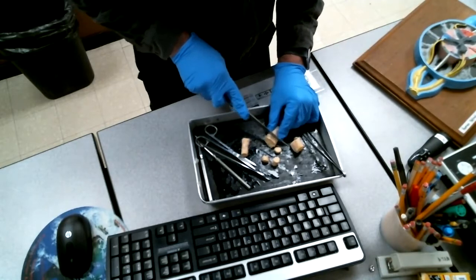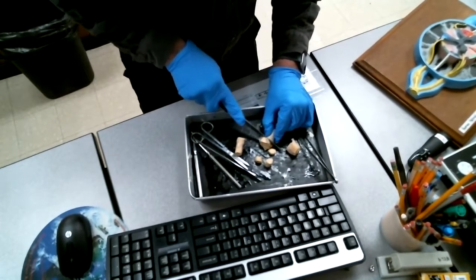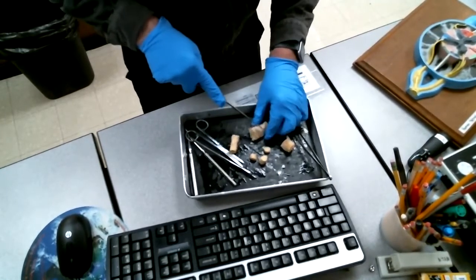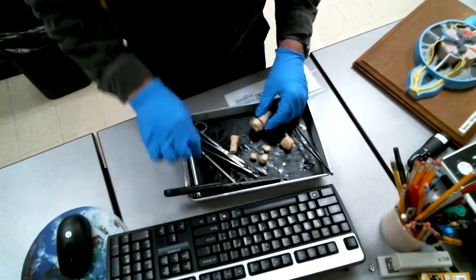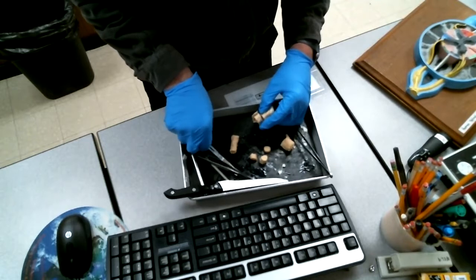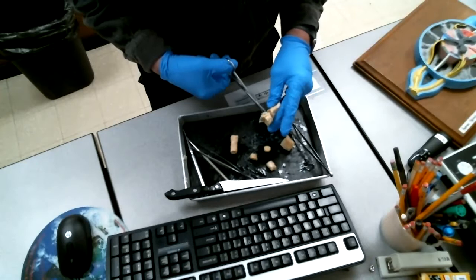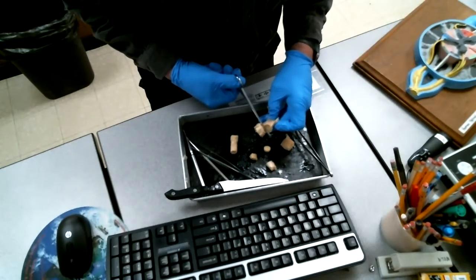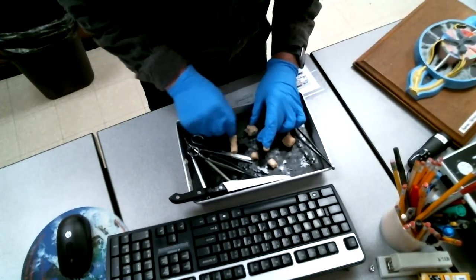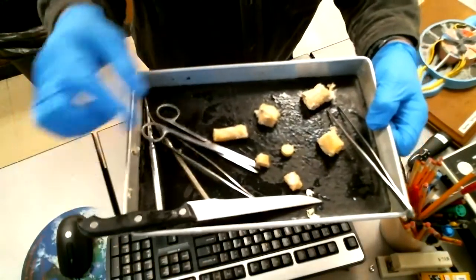scalpel. And so I'm going to use the knife and I'll try to cut through here. And again, this is big enough that I can't really hold it with the forceps. So I'll try and make the best cut I have. The meninges are quite tough. And so I'm through the nerve tissue. I'm going to use the scissors then to cut the last bit of meninges away. Okay. And in that case, again, you can kind of see how it looks there.